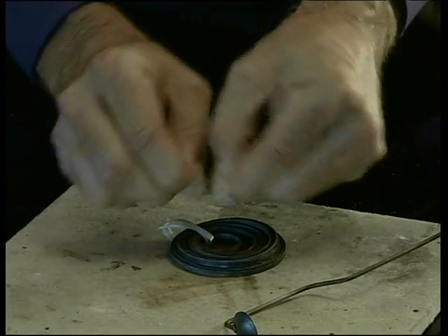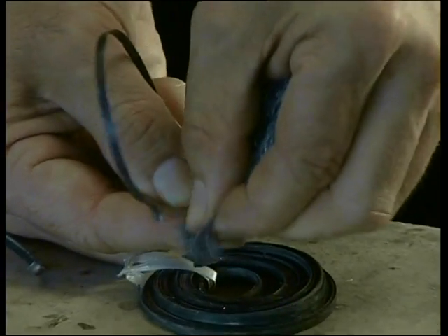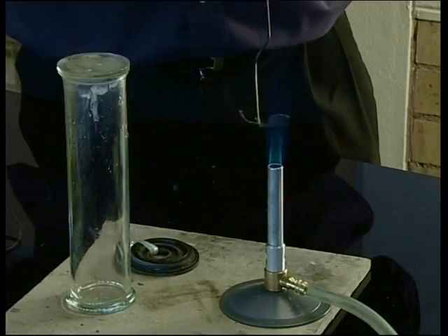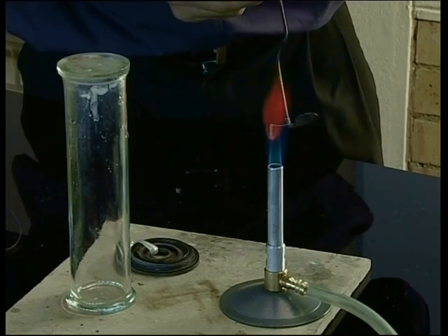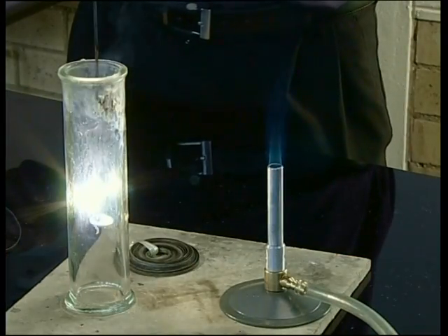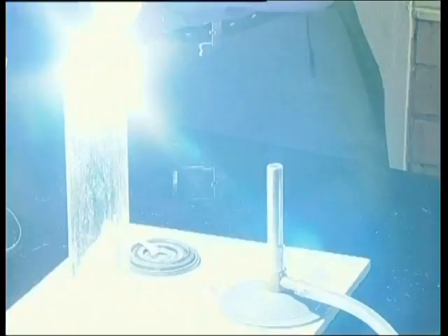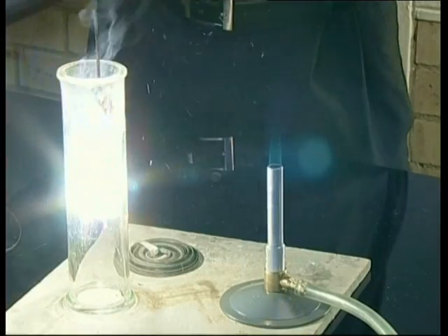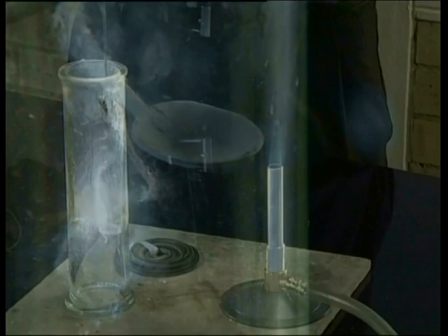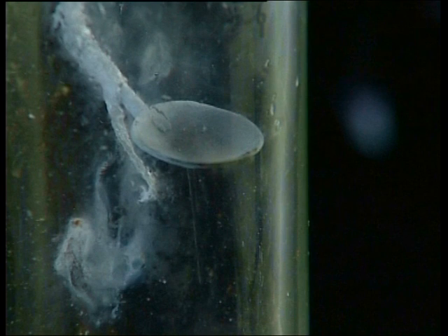First, a piece of magnesium is torn from the ribbon. It needs to be sandpapered lightly to remove any dull coating that might have formed. Next, the piece of magnesium is wrapped around a combustion spoon and set alight over the flame of a Bunsen burner. As soon as it is burning, it is plunged into a jar filled with pure oxygen. Did you see how the bright white flame that the magnesium burned with in air turned into an almost blinding white light in pure oxygen?